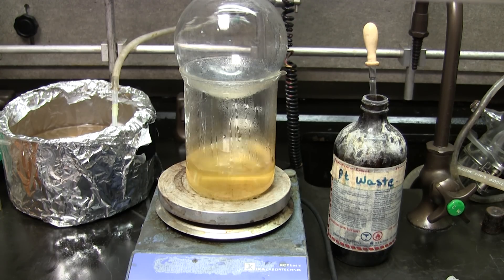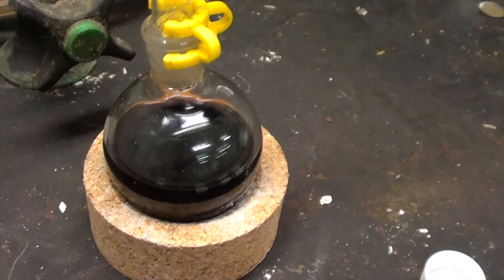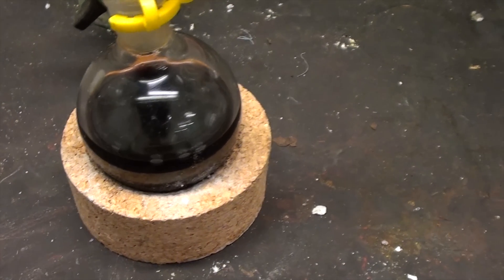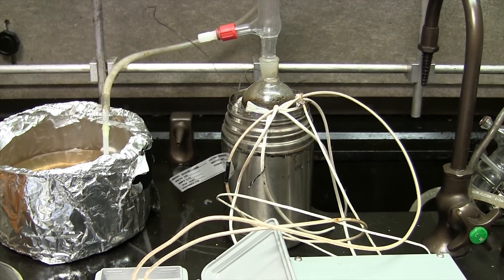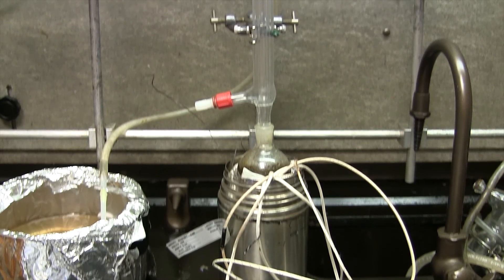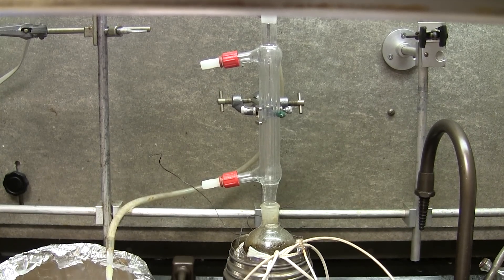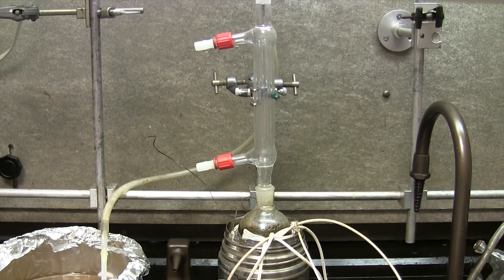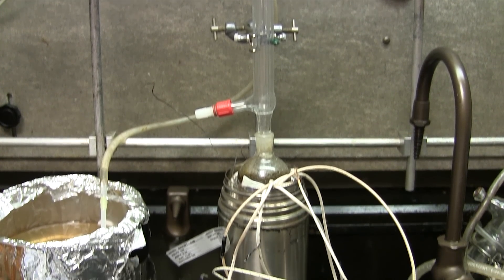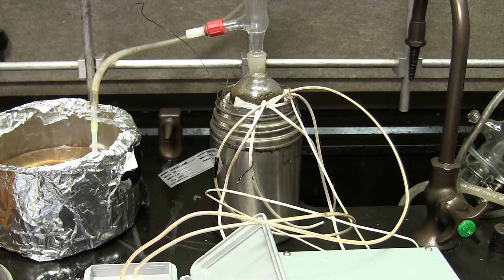Now I'm going to add more chemical waste and continue boiling down. Here is the concentrated platinum waste solution — I transferred it to a 100 ml round bottom flask. Now we're going to set up a high temperature heating mantle; I've shown how to make these in a previous video. I've also put in a condenser column — we're not trying to reflux anything, but just prevent the sputtering and frothing of the waste from losing our valuable platinum. Now we turn on the heating and slowly ramp up the temperature to 400 Celsius, giving plenty of time for the volatile components to boil out.